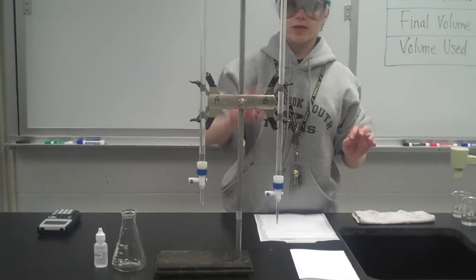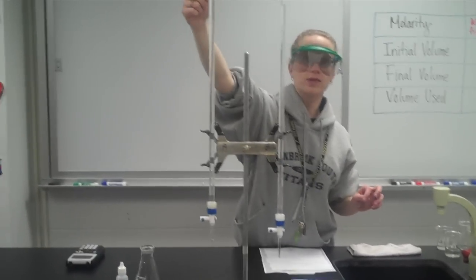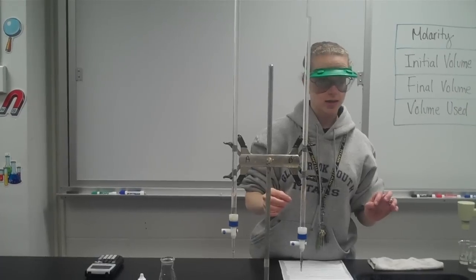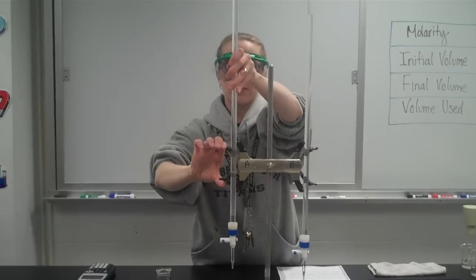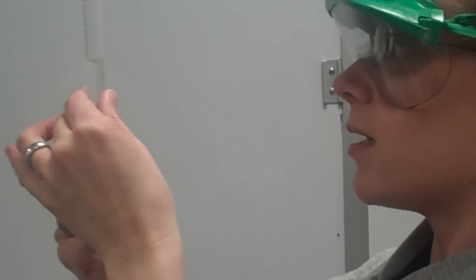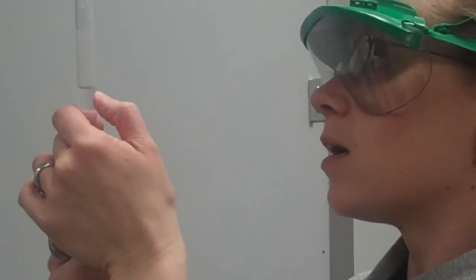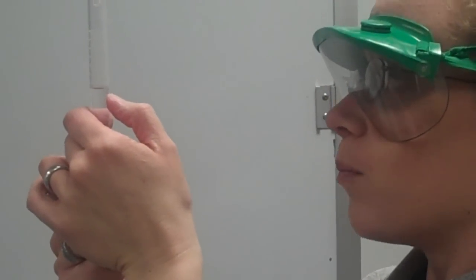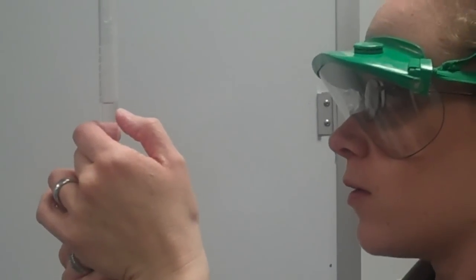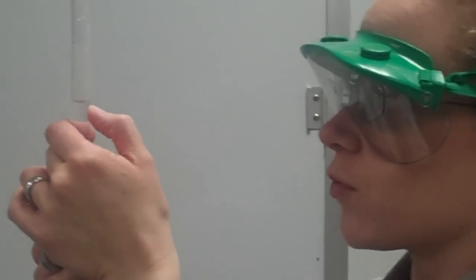The next thing I want to do is read both of my burettes. I want to know what the level of base is and what the level of acid is. That's really important data to write down. So let's start by looking at my acid. I hold the burette at eye level so that I can look closely and see where the bottom of the meniscus is. The bottom of the meniscus is hitting, it looks like, between 3.4 and 3.5. Well, yeah, so 3.40, actually right on the 3.4 mark.